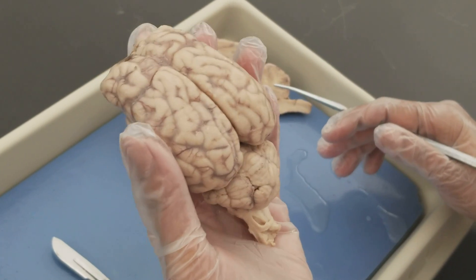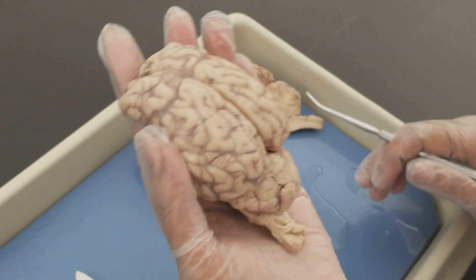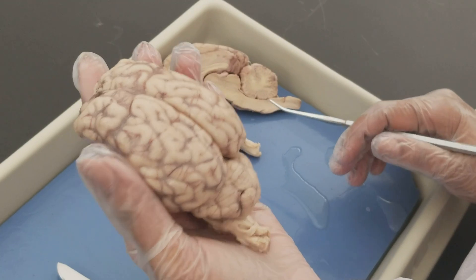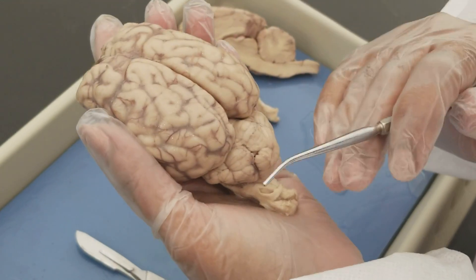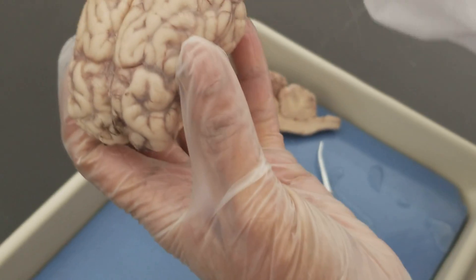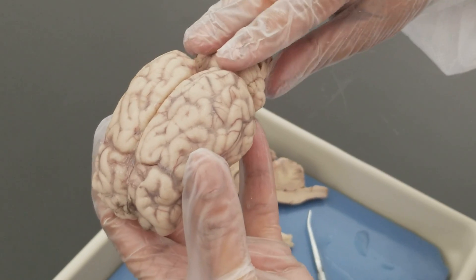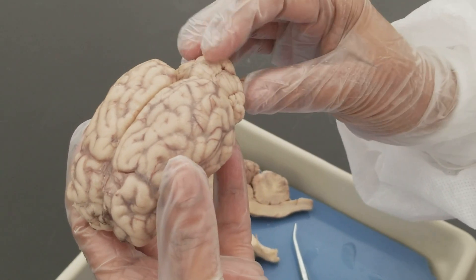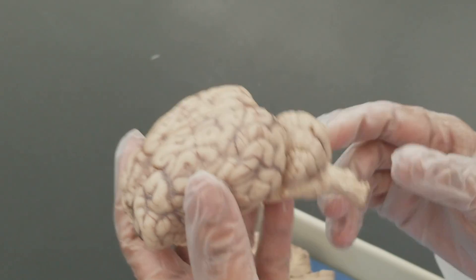We are going to do a video of sheep brain dissection today. On my hand you see a sheep brain, really small in size, and that's one of the differences between sheep brain and human brain — the size. Human brain is much larger and also more rounded. The sheep brain is kind of elongated, and because sheep are four-legged animals, the brainstem and cerebellum are more posterior, while in human beings this area would be more inferior because we are bipedal.